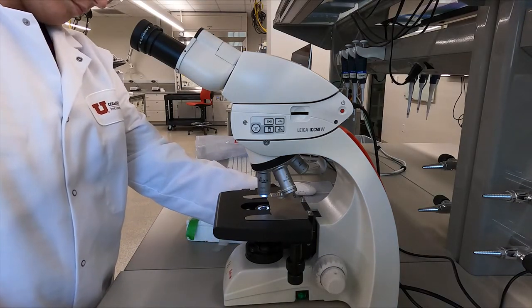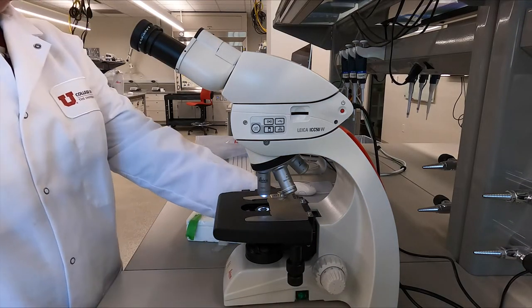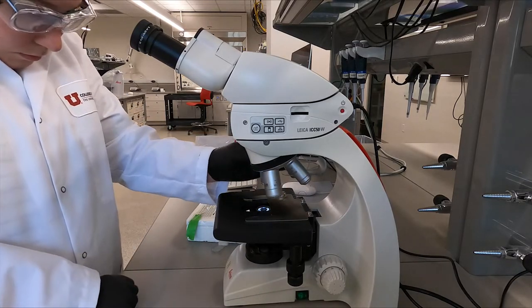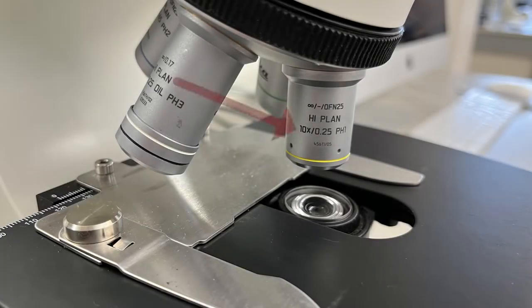Then check that the stage is at the lowest position and that the revolving nose piece is rotated until the lowest powered objective has clicked into position. For this particular model, the lowest powered objective lens is the 10x objective.